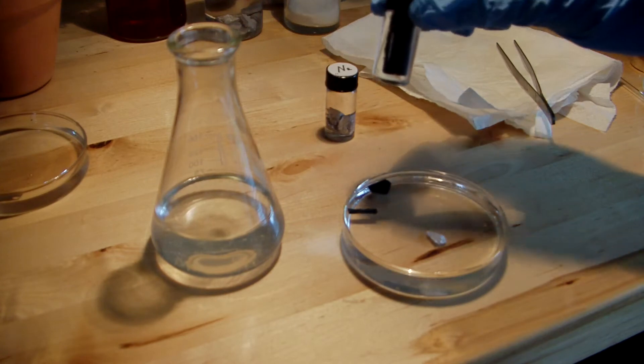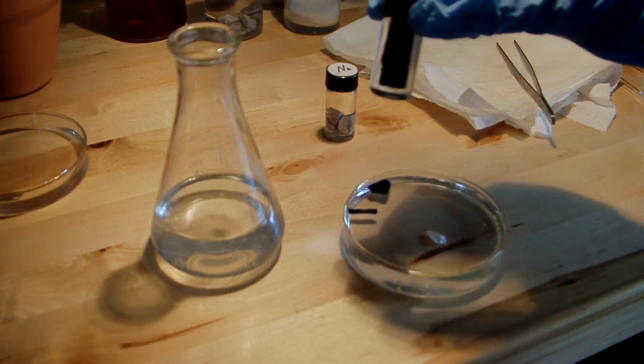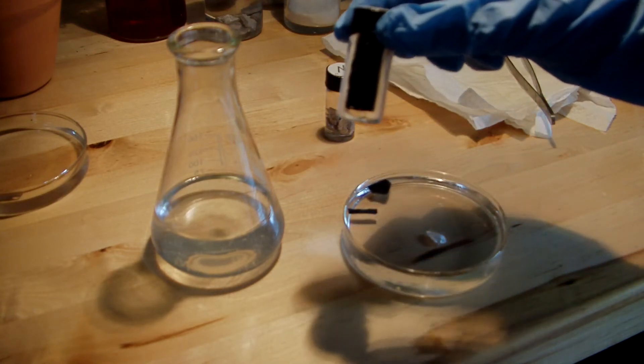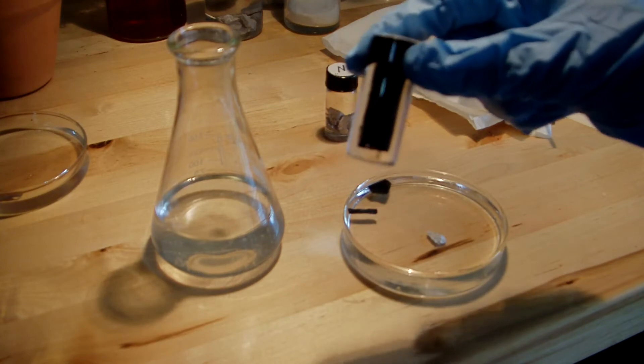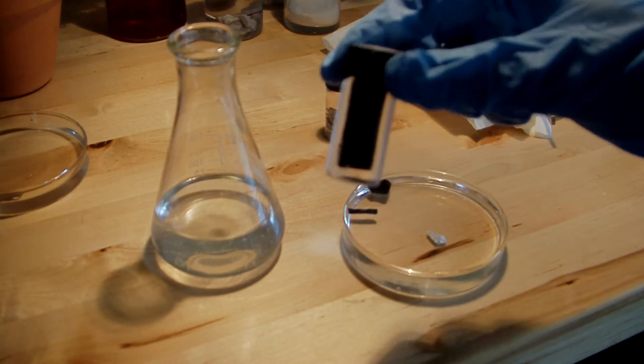Lithium is the lightest metal. It's actually number three on the periodic table, just after hydrogen and helium. And you can see it's so light that it actually floats in the oil that I have it immersed in here.